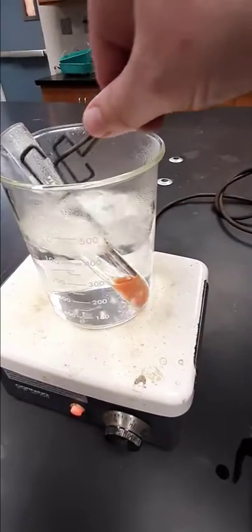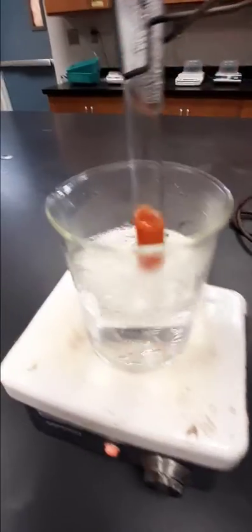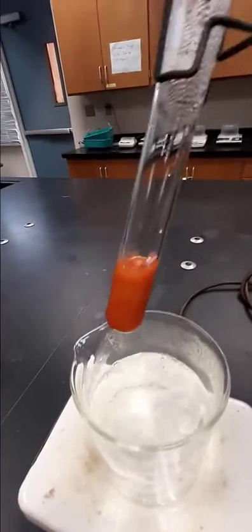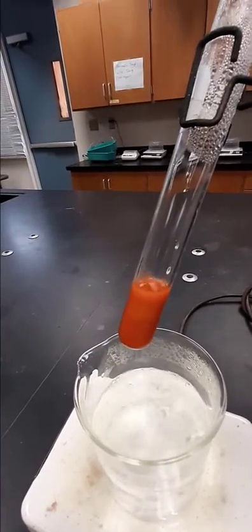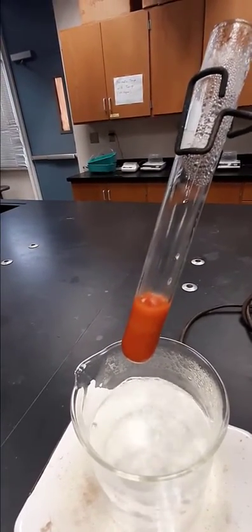After five minutes of heating, a change has occurred. What was once a blue solution has taken on a red color — a new color indicating a positive result for glucose.